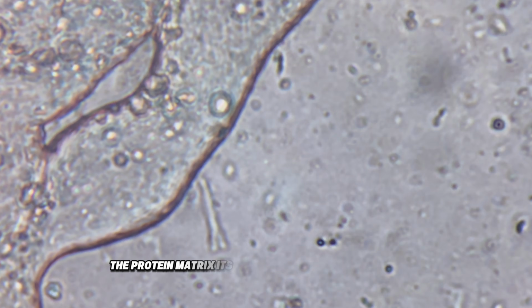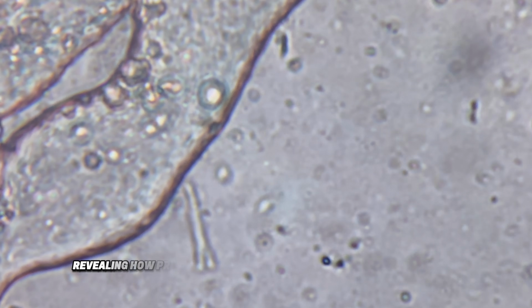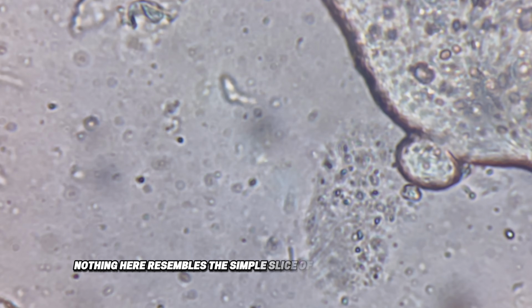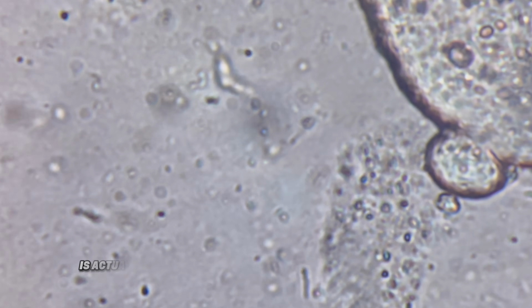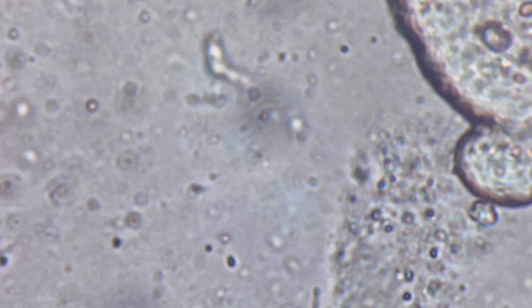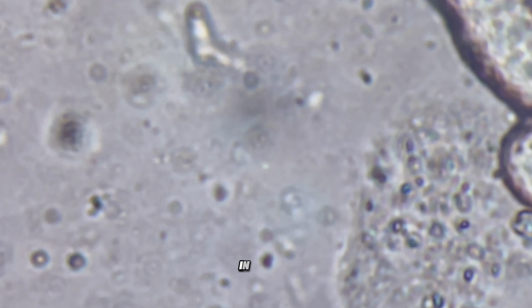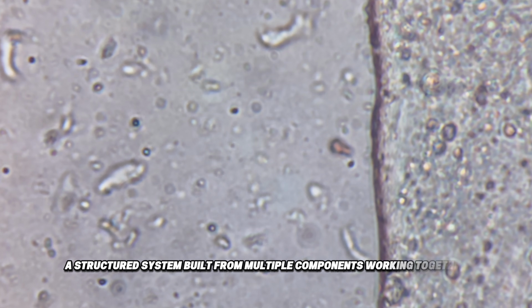The protein matrix itself looks fibrous and fragmented at the smallest level, revealing how processed and transformed the original material has become. Nothing here resembles the simple slice of sausage we see every day. What appears uniform is actually a highly complex composition of microscopic elements. Looking this closely changes the perception completely. What seemed like a single product is, in reality, a structured system built from multiple components working together.